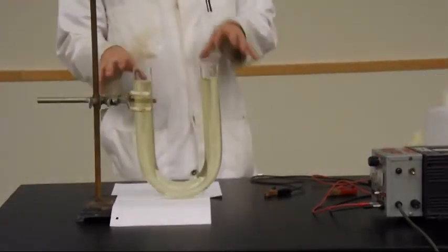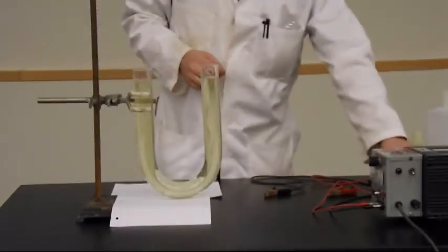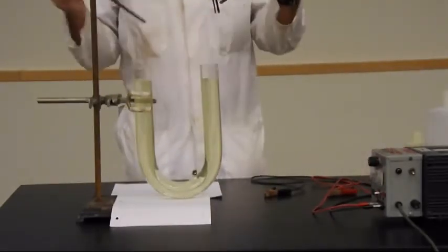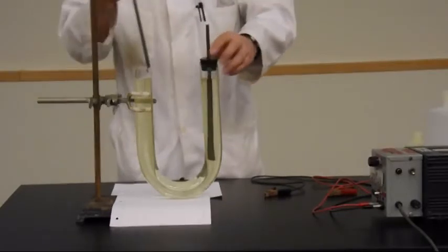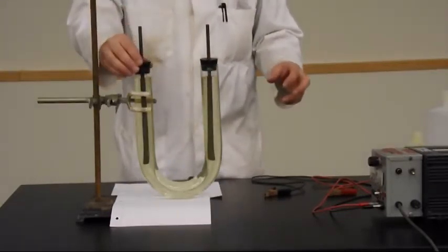So there I've got it. It's slightly yellow because a little bit of oxidation of the iodide.